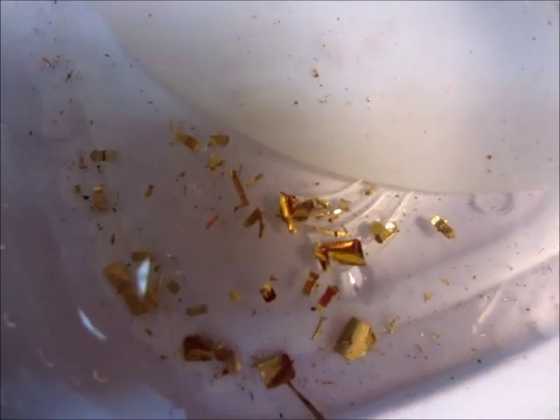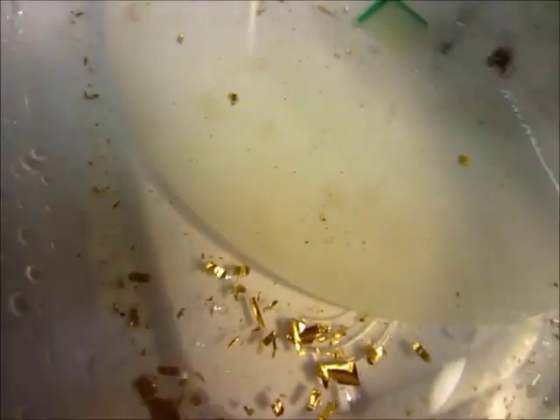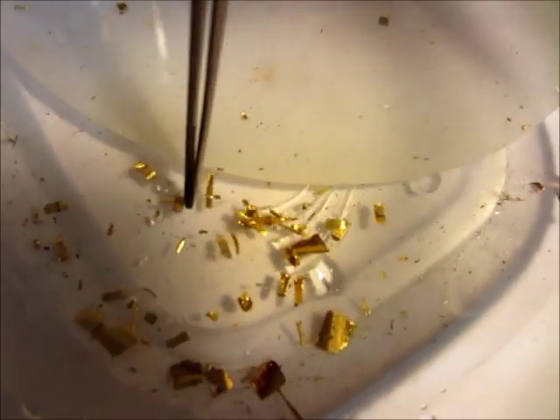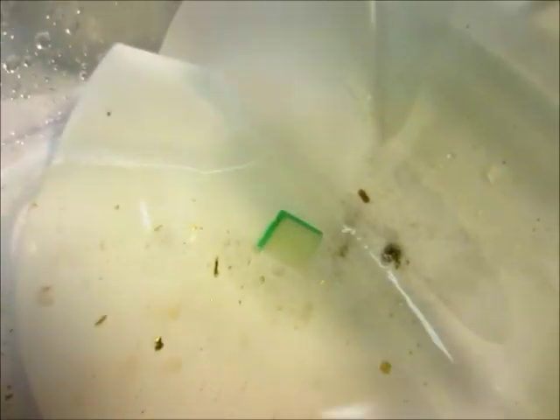I'm pretty sure this is gold now because it did not get dissolved. Some of this is just hollow because the actual copper or whatever metal inside got corroded right out from the inside. I used this filter paper to filter it through the funnel, and this is what the acid looks like now — it's all green.